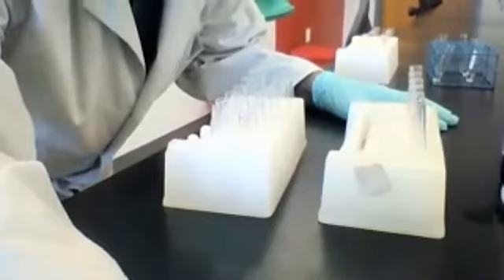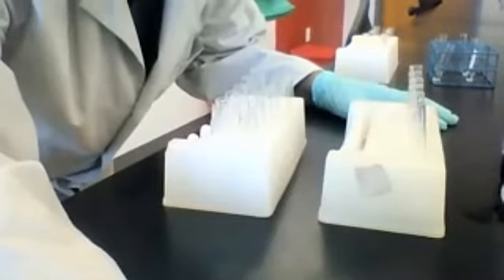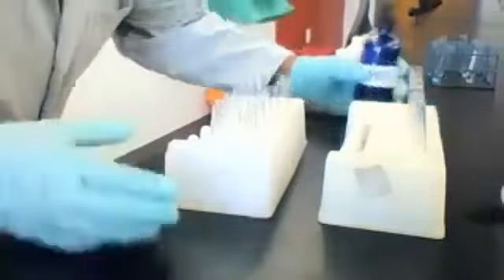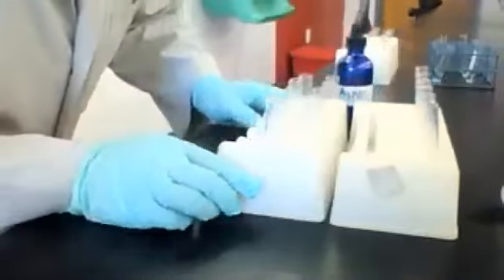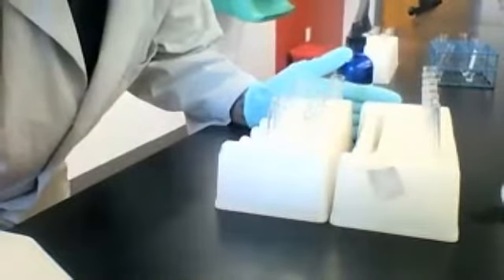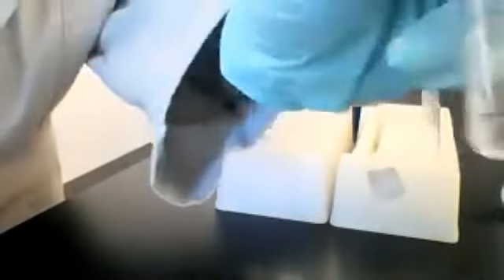the report sheet. We're starting with part A, which is the reaction matrix. Our first reagent is going to be silver nitrate. For each of these, I will show you what the test solution looked like before, and then I'll show you what it looks like after I add the reagent. Okay, so let's get started. Our first test solution is sodium chloride.